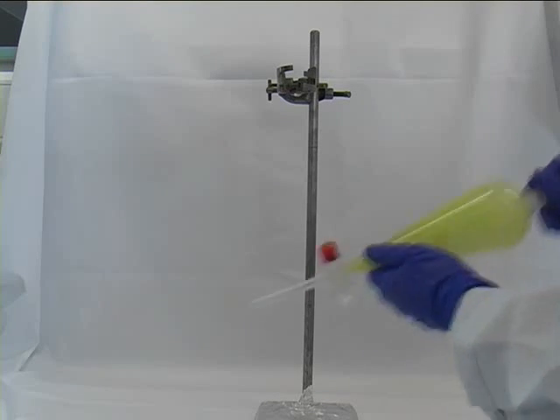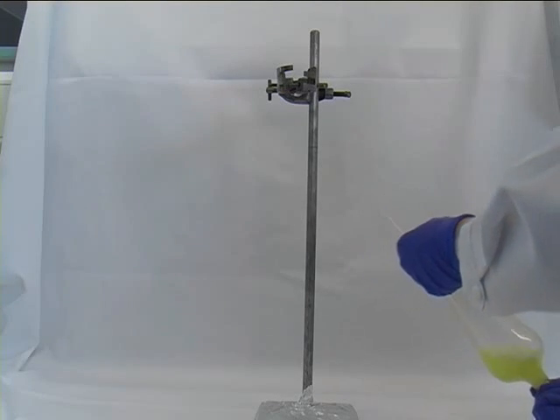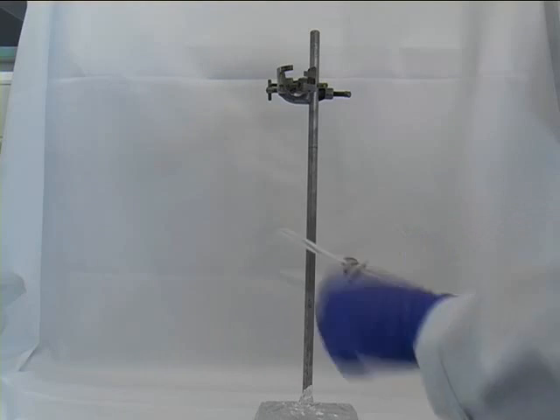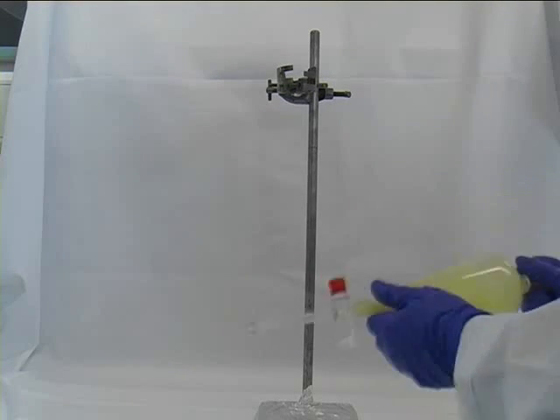As you could hear, some pressure has built up that needs to be vented. Again, as you could hear, the same happened after you shook the solution.